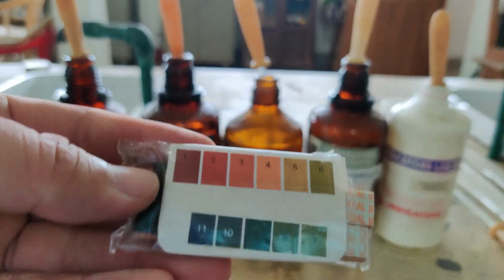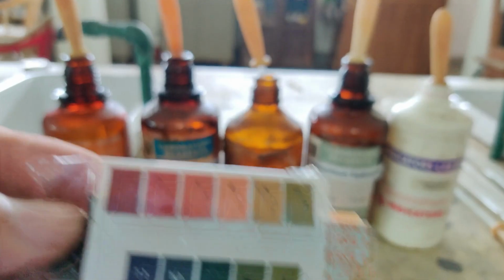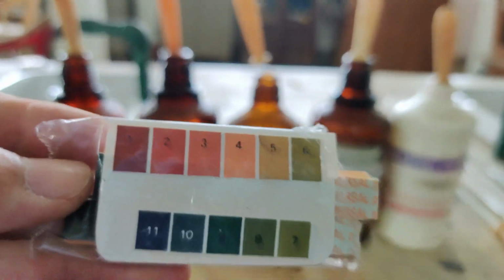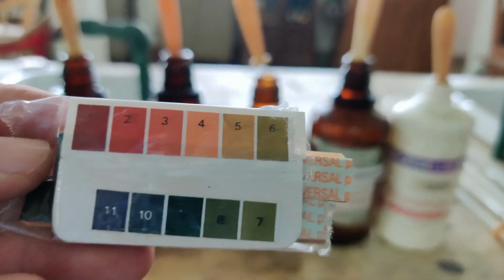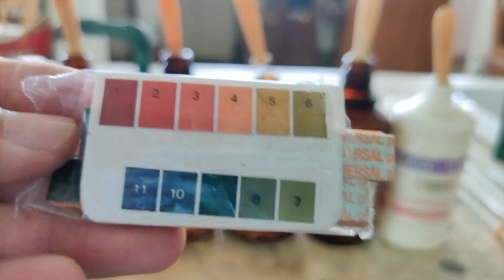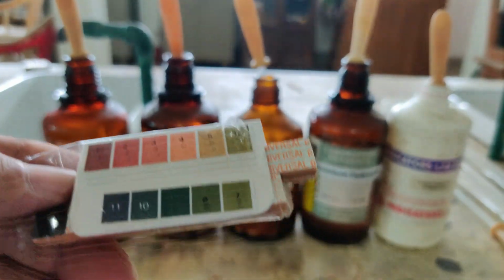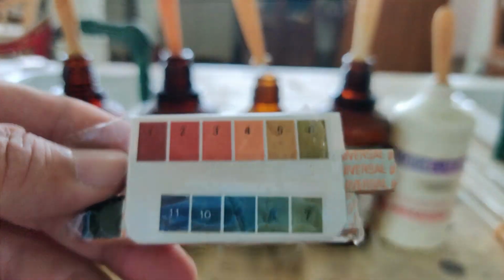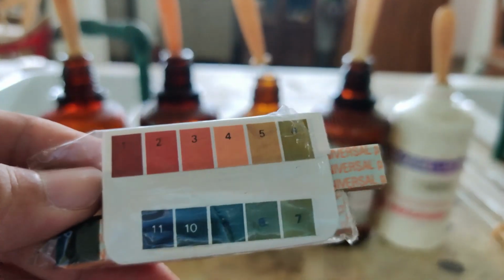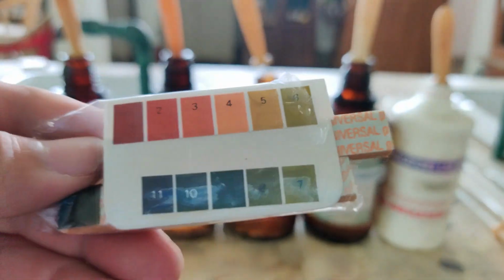Let me tell you how to compare the pH. I was talking about different color paper. Since this indicator will only give you pH from 1 to 11, you can see the number 1 has a different color, 2 is a different color, 3, 4, 5, 6, 7, 8, 9, 10, 11. This color chart comes with the packet. We have to compare the color change with this one, so that you can identify which color the paper has changed to, and then identify the pH value of the solution.